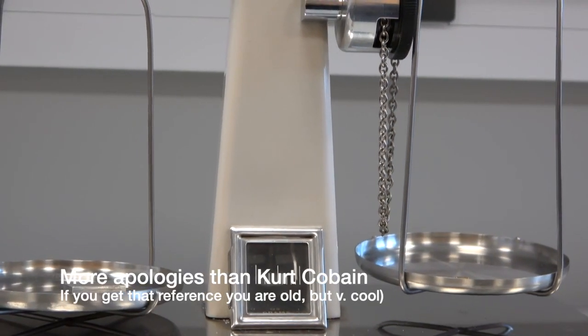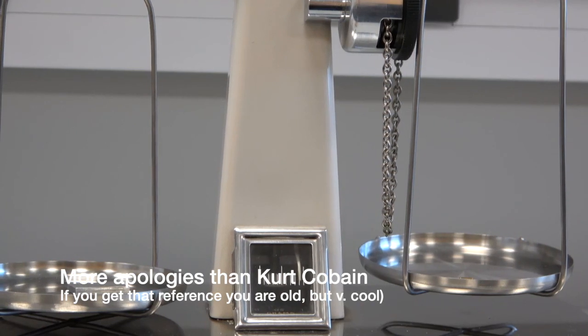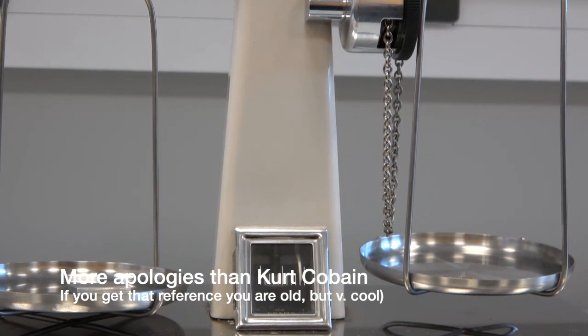Brief correction there. I think I said 2.99 grams, but it's actually 2.89 grams. Sorry, I just completely misspoke.